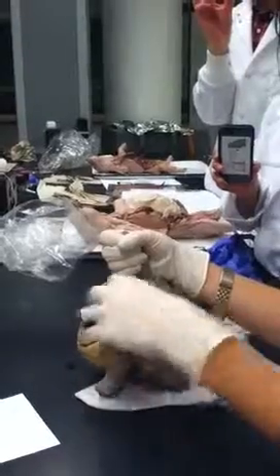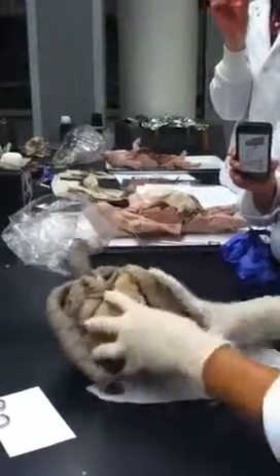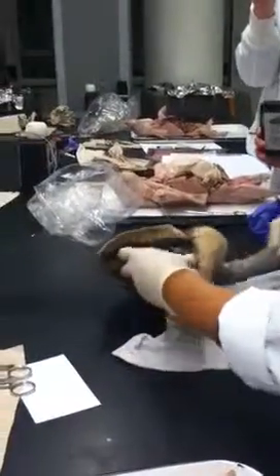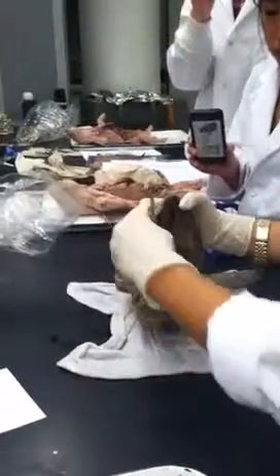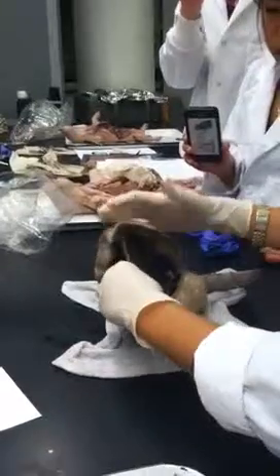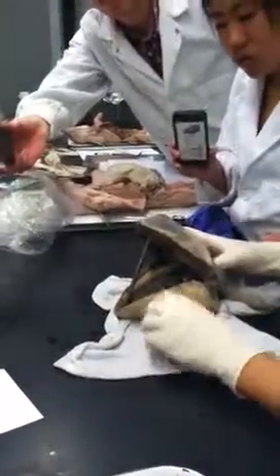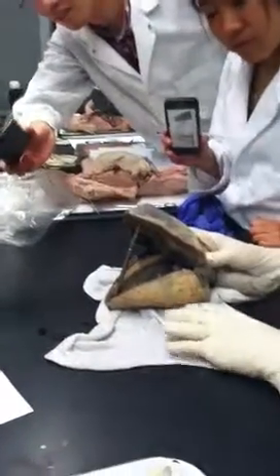Okay. So there's something else I wanted to say. When we give it to you on the midterm, it'll be propped open kind of like a peanut. So we'll put a probe in there kind of like this. Yeah, I can turn it. There you go. Everyone see it?